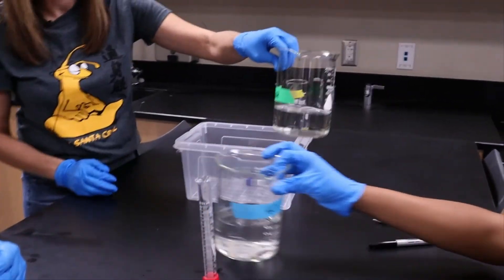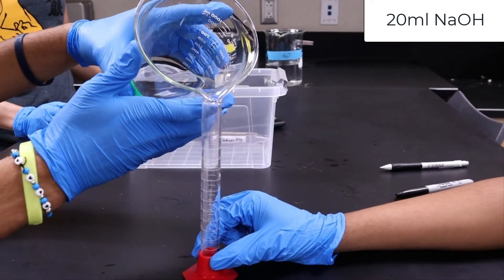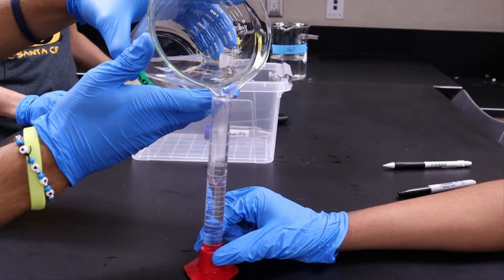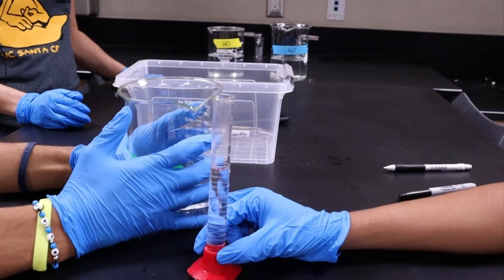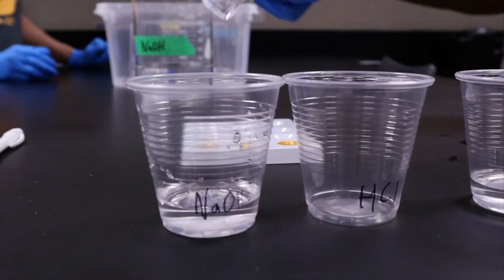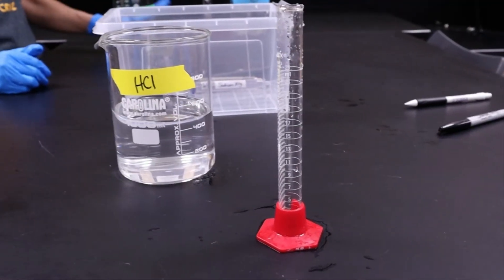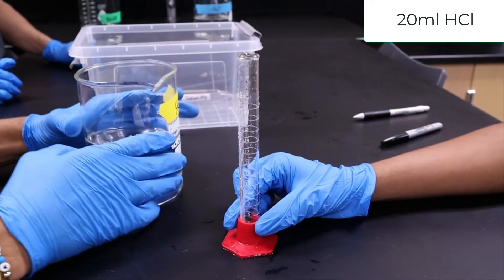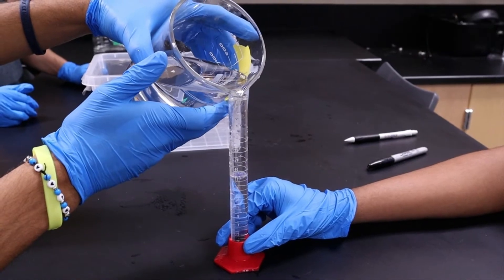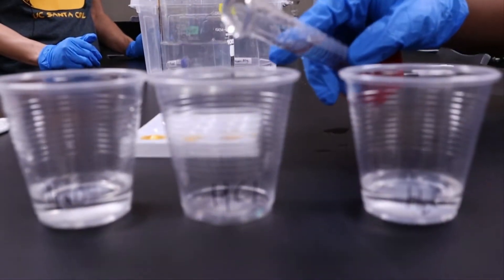Next, measure out 20 milliliters of sodium hydroxide and put that in the cup labeled NaOH. Next, rinse out your graduated cylinder. Now that your graduated cylinder is rinsed, measure 20 milliliters of hydrochloric acid, HCl, and place it in the cup labeled HCl.